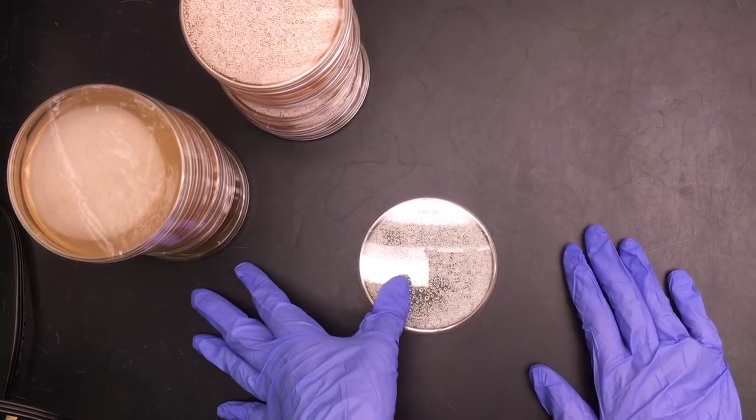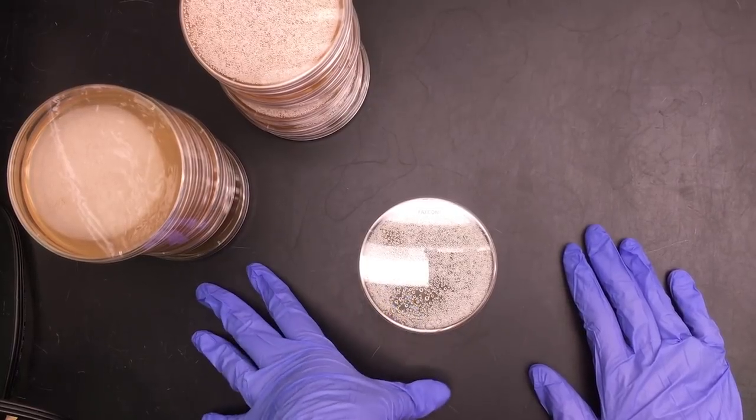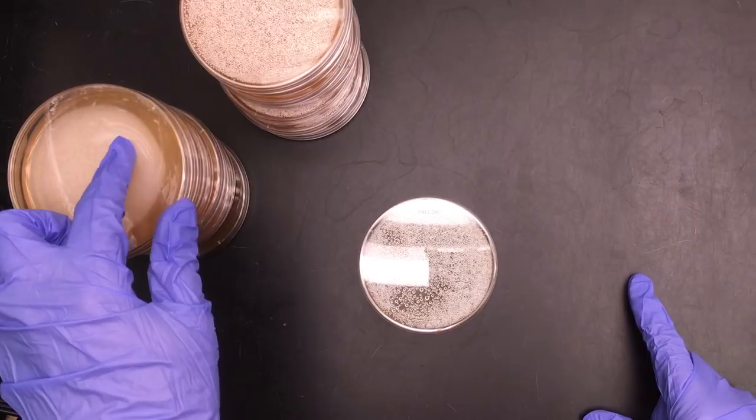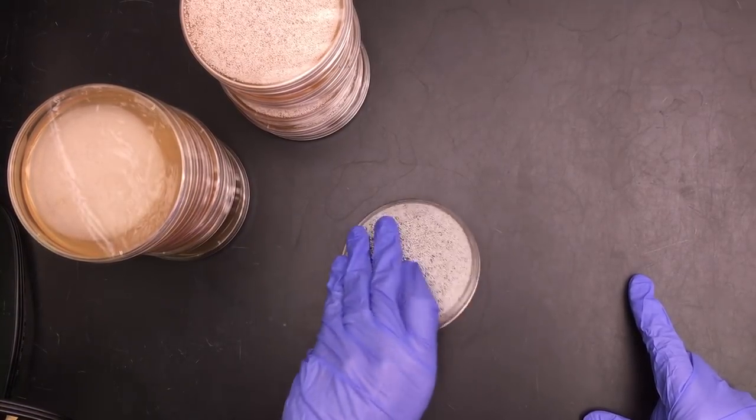Today I'm going to inoculate several petri dishes to check for fecal coliform bacteria in several water samples. So these petri dishes here have agar poured in them. Let me turn it over.